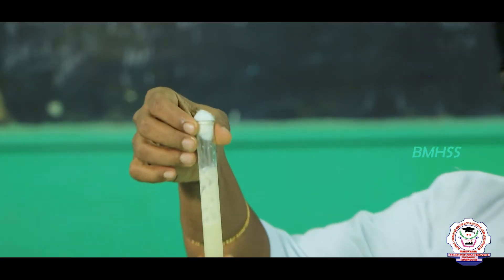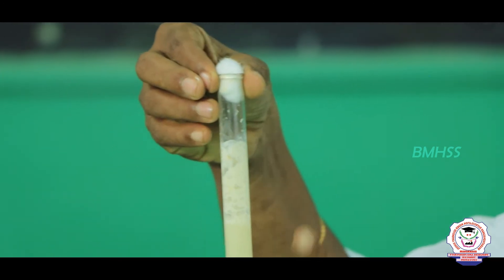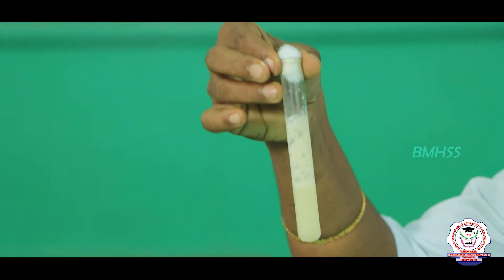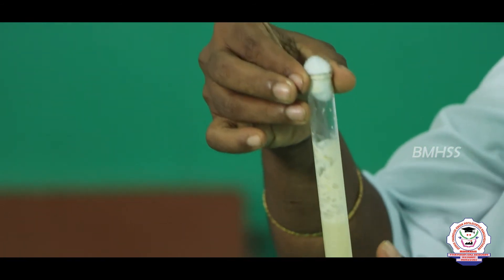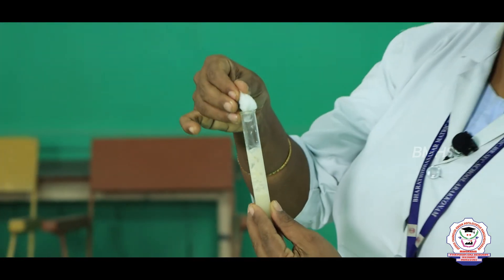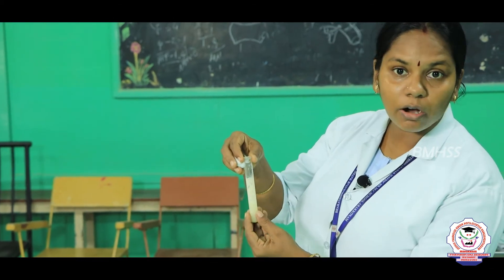The fermentation reaction is completed in this test tube — you can see the effervescence is formed inside, white color. This denotes that the fermentation reaction is complete, and the gas evolved is carbon dioxide. How do we confirm it is carbon dioxide? After removing the cotton plug, if you pass this gas into lime water, the lime water turns milky. By that we can conclude that the gas evolved is carbon dioxide.